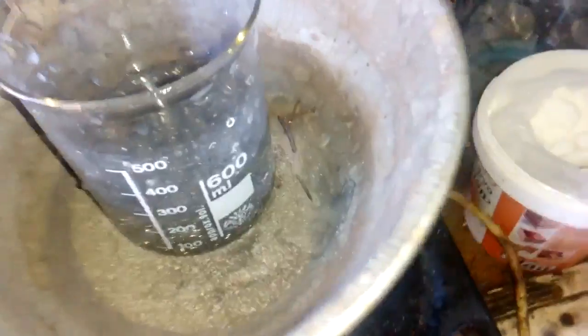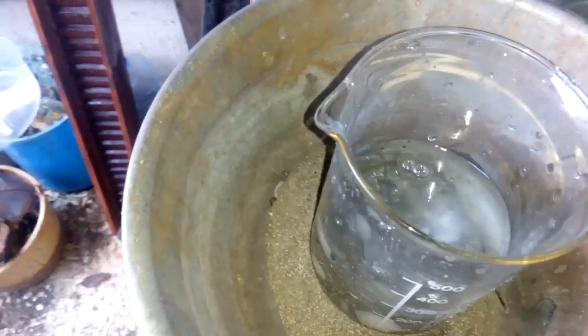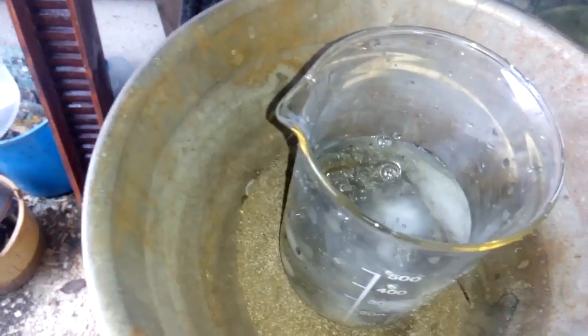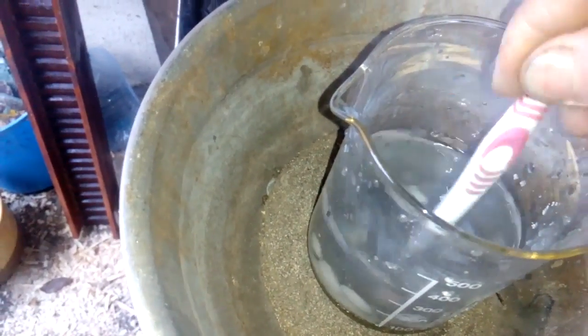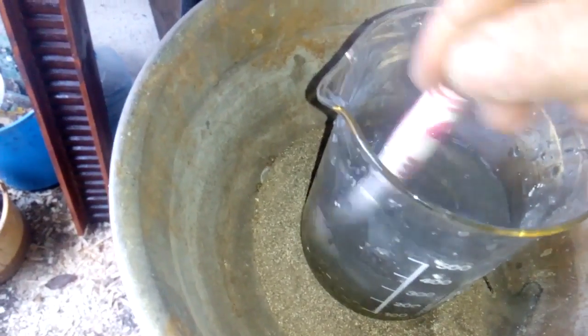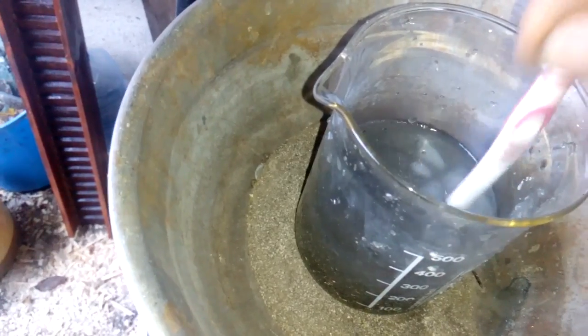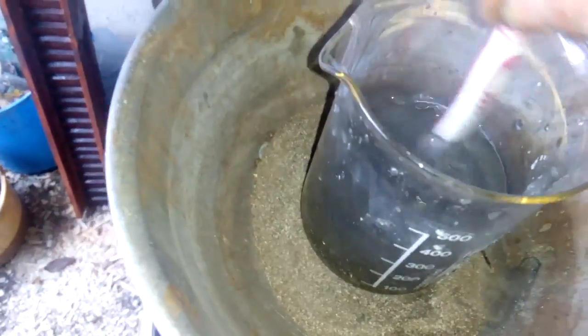We will add some HCl and we will add some sodium nitrate. I will add a teaspoon. Okay, now I cover that and I leave it on the low heat.